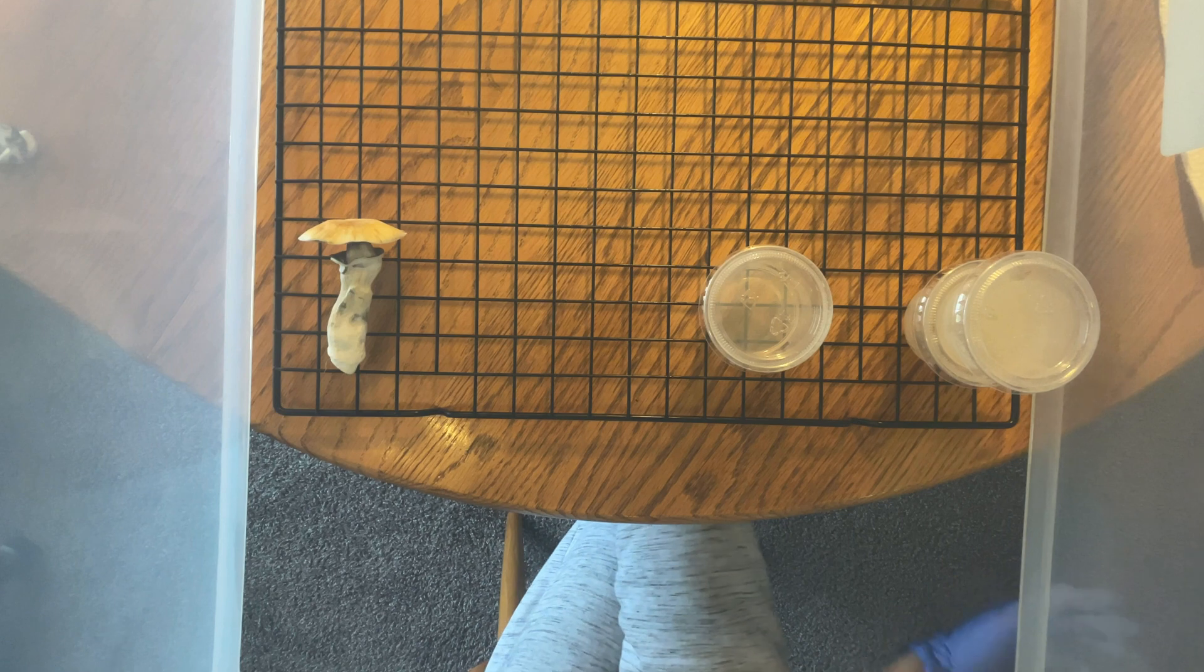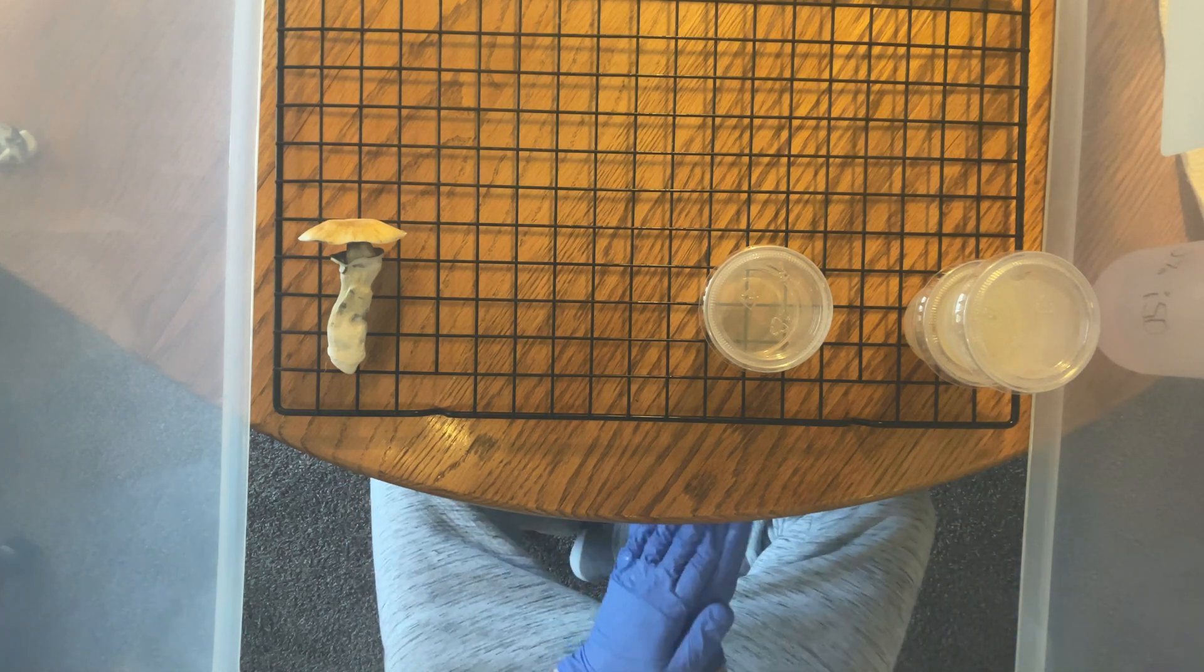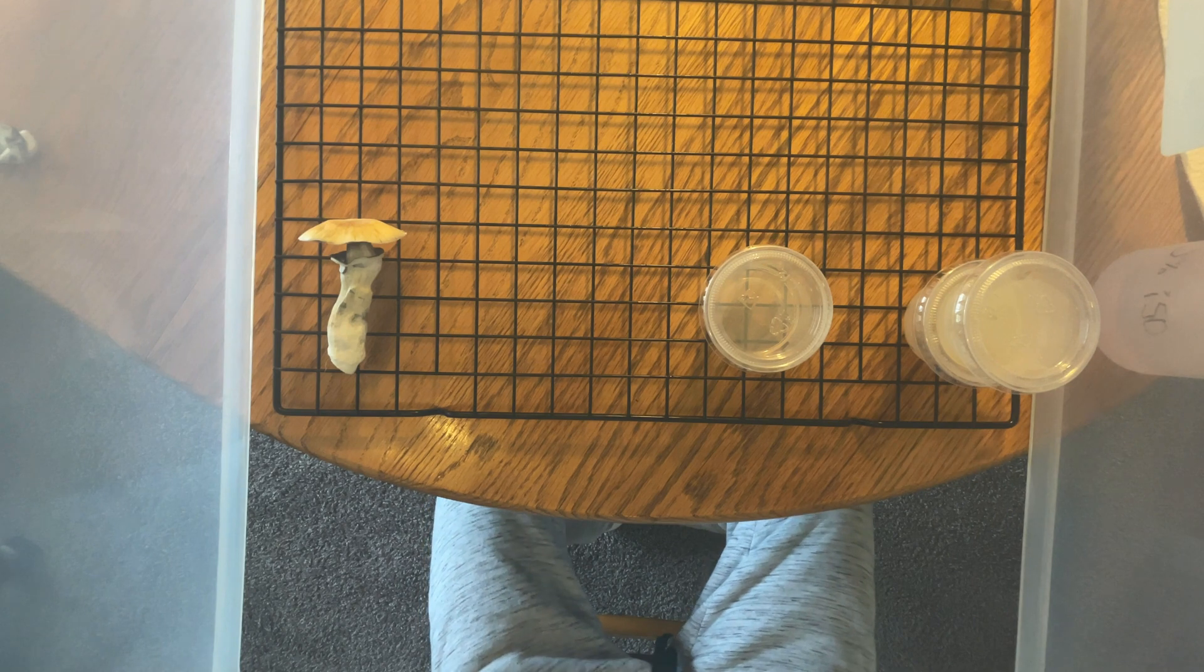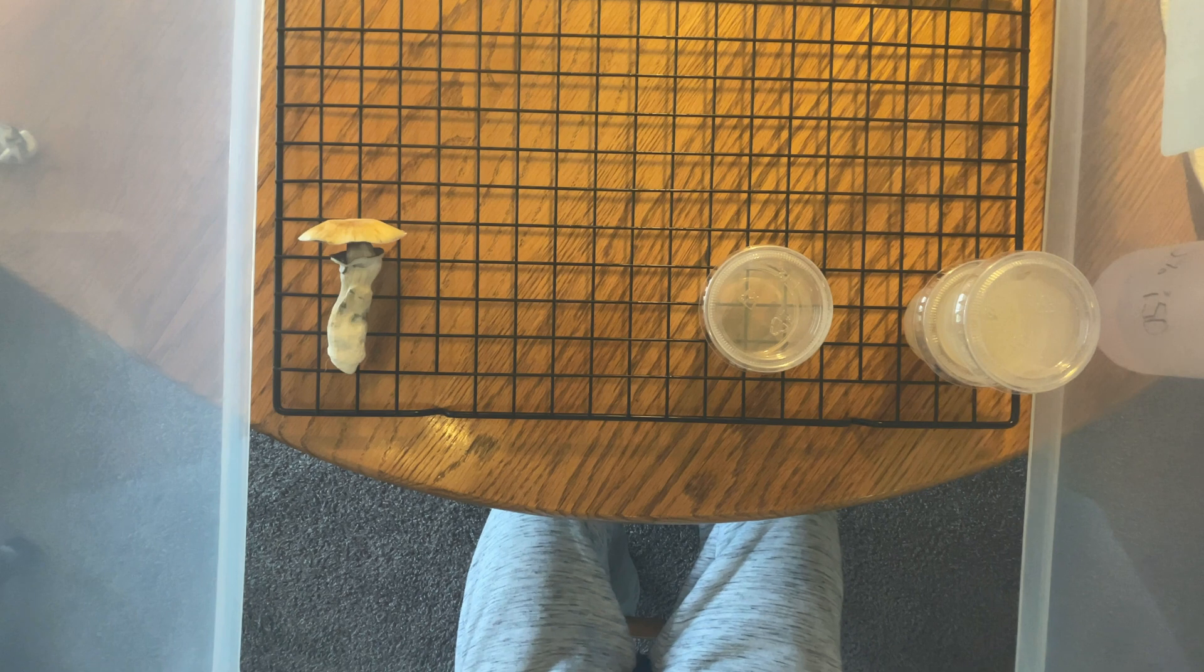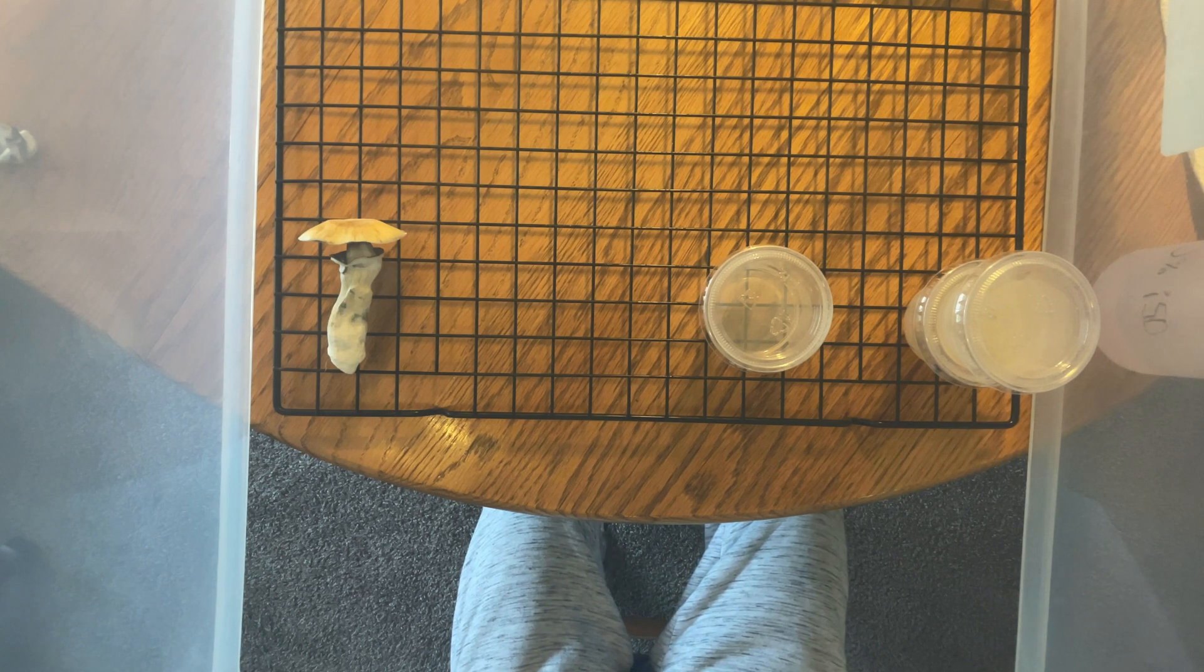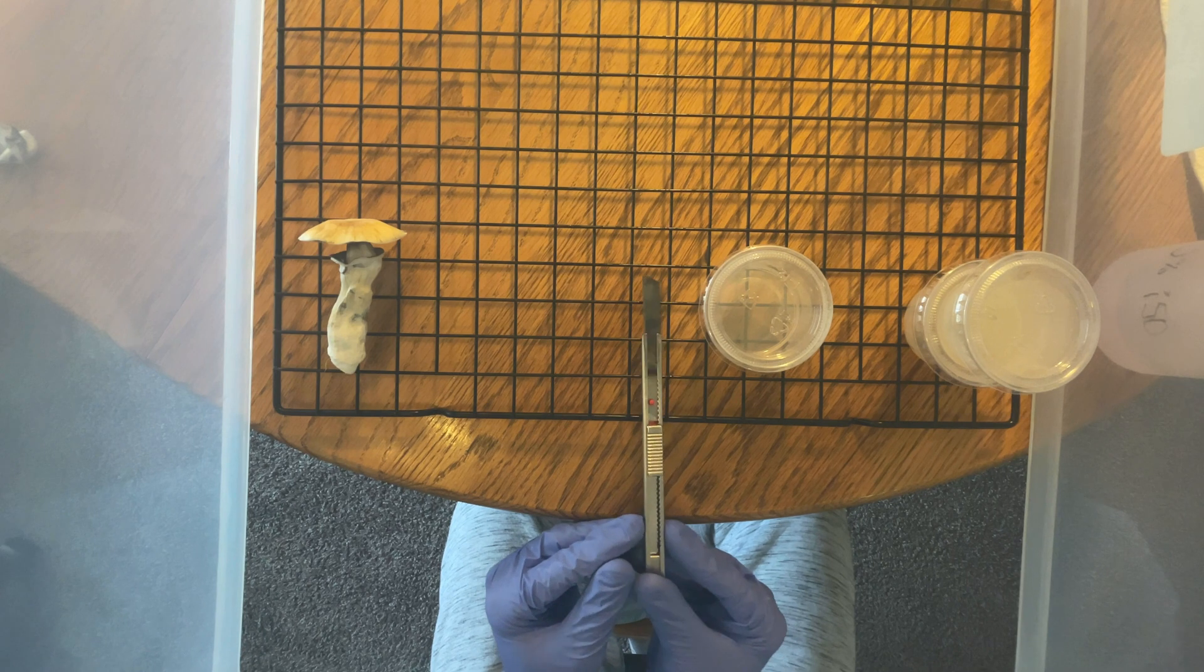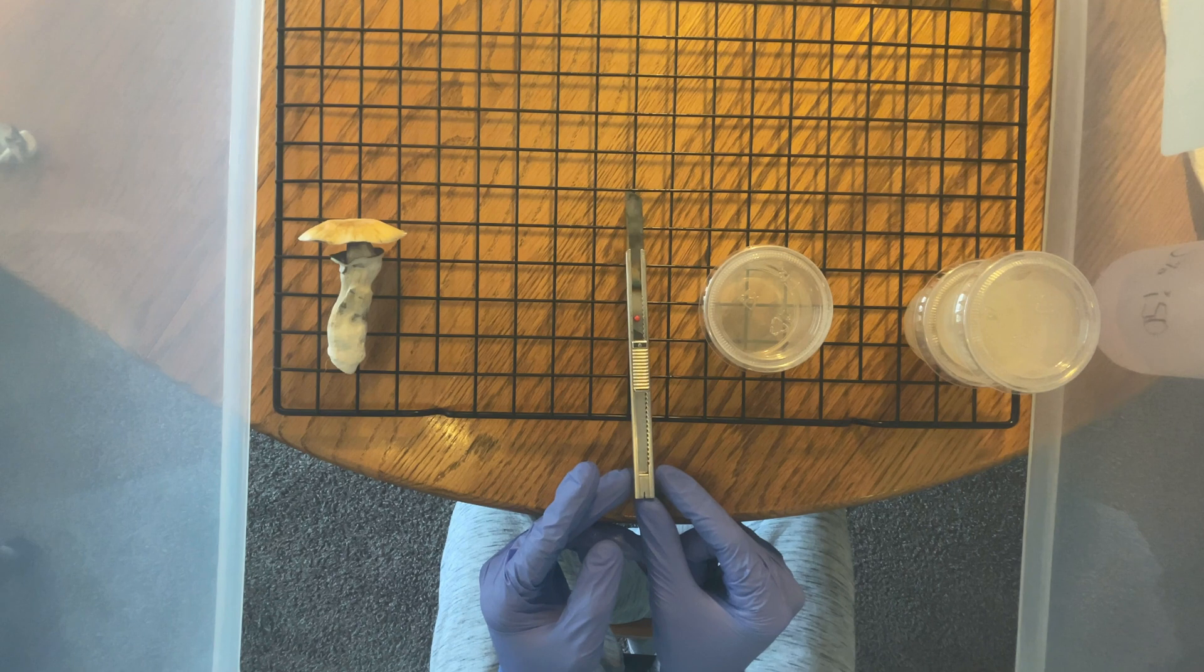I always make sure to re-iso my hands, as this is something that will prevent cross-contamination onto the plates. Always make sure to flame sterilize your blade in between as well, just so that there's no cross-contamination. It really helps in the end.